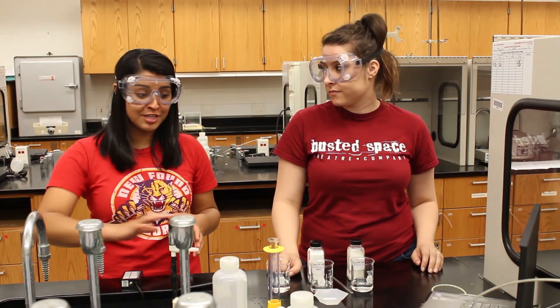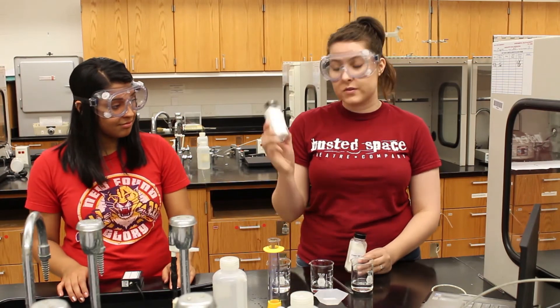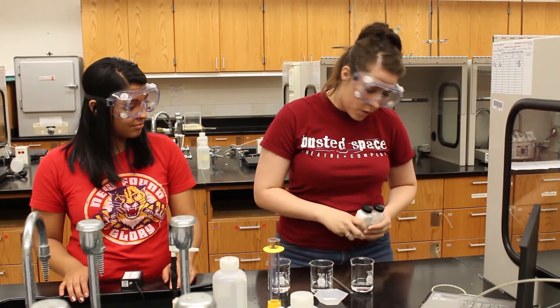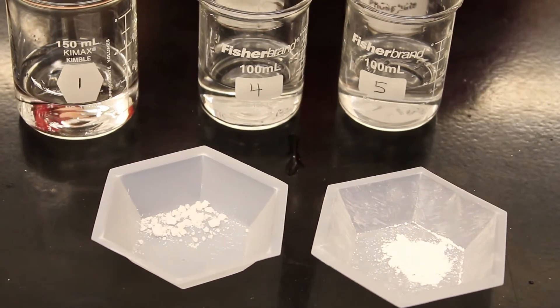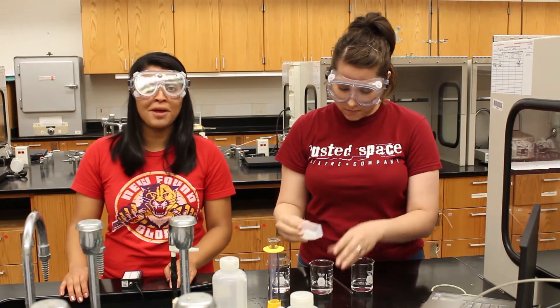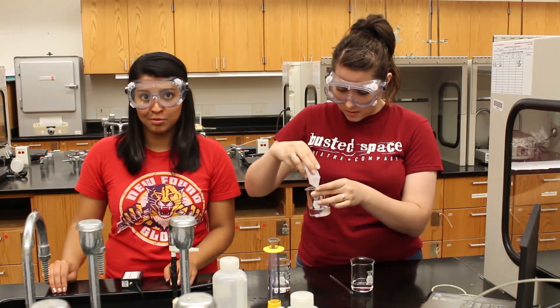You'll want to make sure that your setup is correct before you start. In the beginning of this lab, you'll want to prepare aqueous solutions of both sodium chloride and sucrose, and you'll want to obtain two grams of your solid on the digital balance like I did earlier. Make sure you record your mass to up to three decimal places.